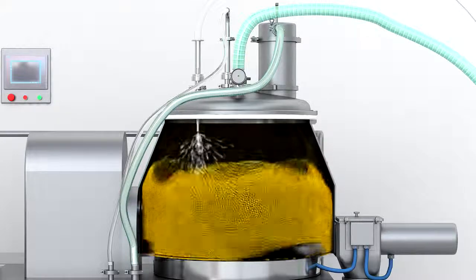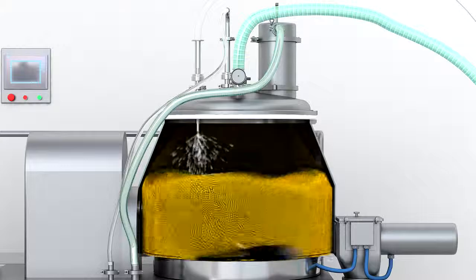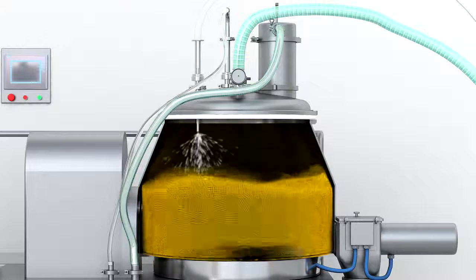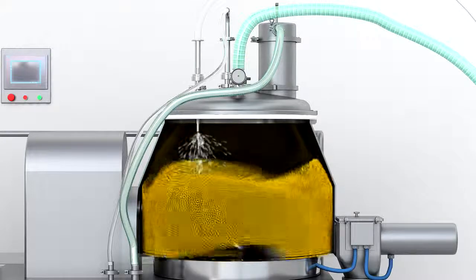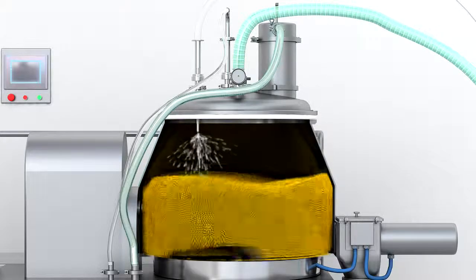The materials rise along the container wall. When they rise to the top of the cone position, they fall back to the center position due to gravity. The continuous mixing movement makes materials form a mechanical spiral fluidized state, realizing an even mixing result.